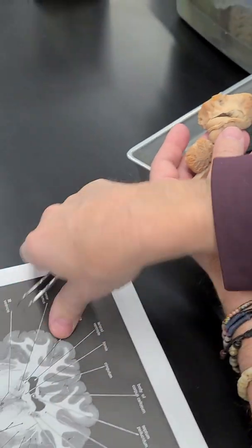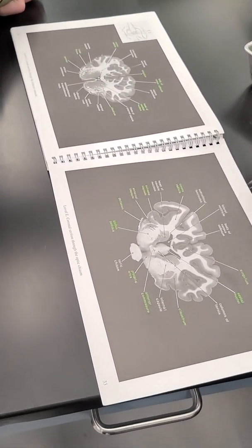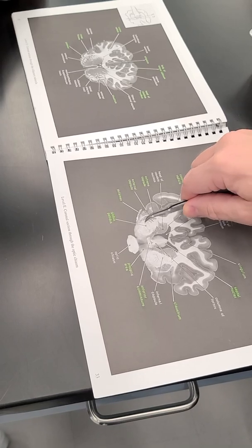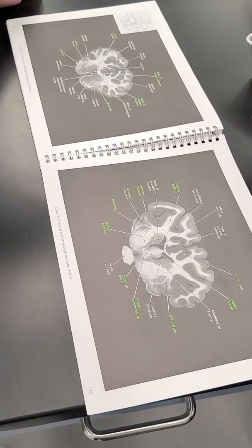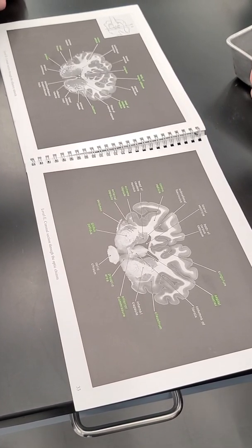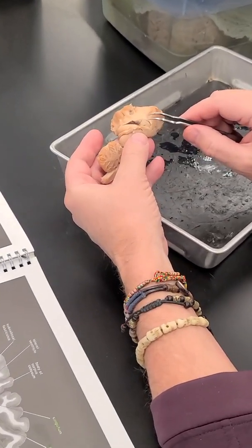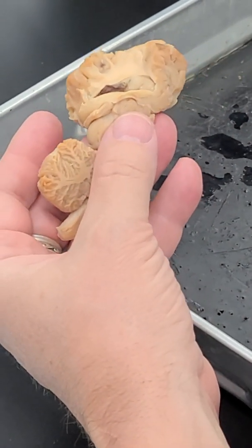And so if we look at these guys in here, these are the basal nuclei right here. Globus pallidus, putamen, and caudate. And this is the corpus striatum. When we talk about the dopamine fibers from the substantia nigra, that nigrostriatal pathway, the dopamine's being released in here. And that's what we'll be talking about for the next few days. And that's this bulge underneath here.